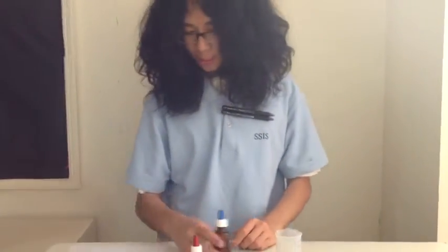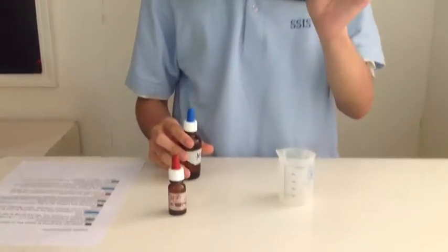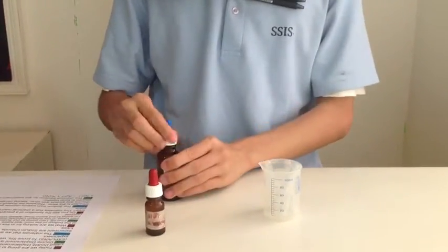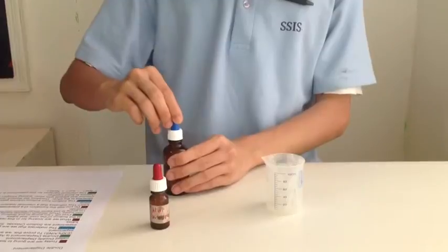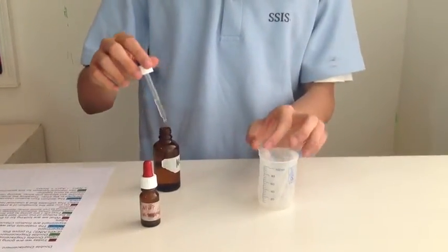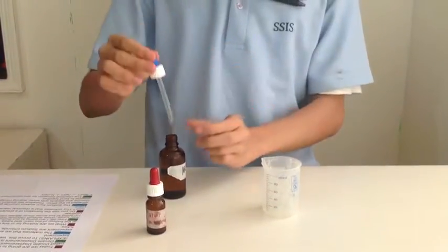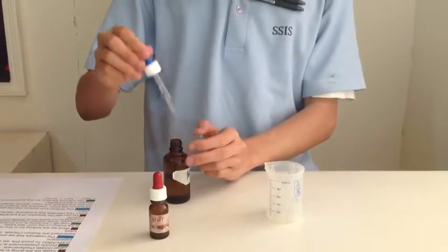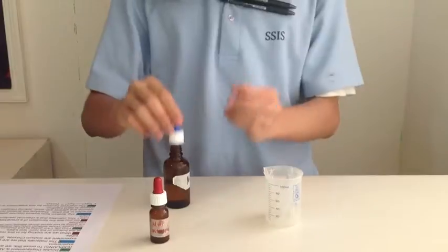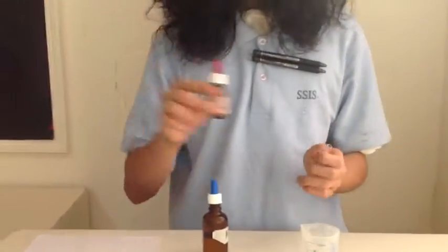What we're looking at is this reaction is precipitation. First off, I'm going to put sodium chloride inside the mini tubes. Secondly, I'm going to put some silver nitrate into the sodium chloride.